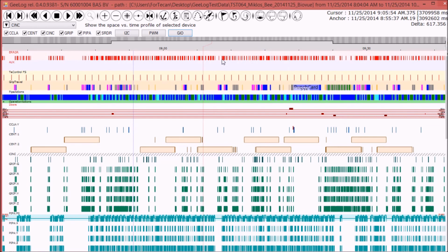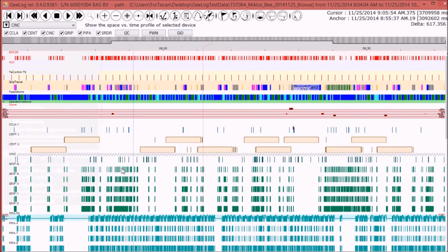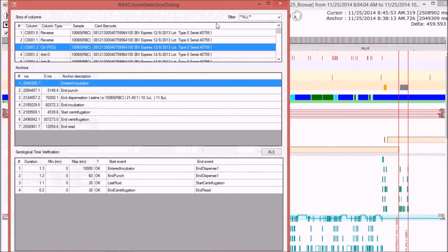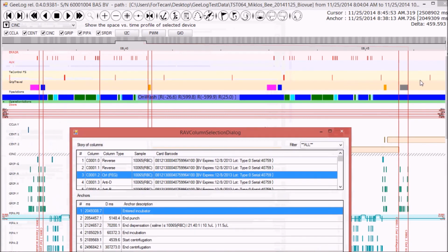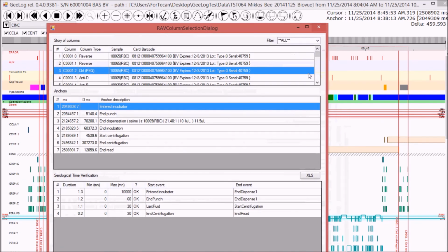As a final observation, I would like to draw your attention to what is called RAV, Redundant Analytical Validation. This is still a prototype, but it's already working, at least as a first prototype, that analyzes all the data, which are only geometrical data and kinematic data, that have been extracted from these log files in order to reconstruct the assays done.